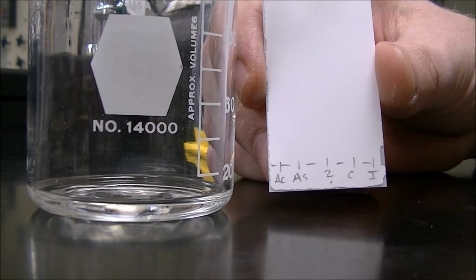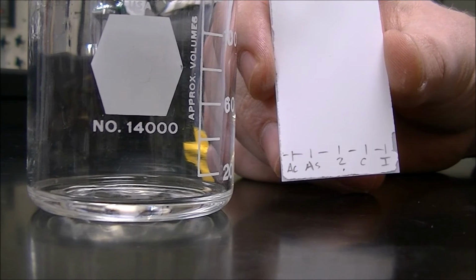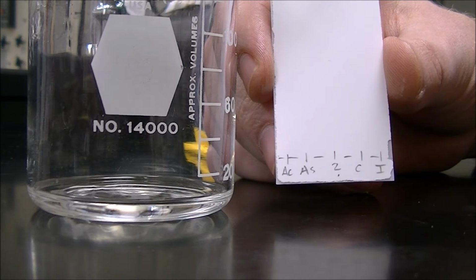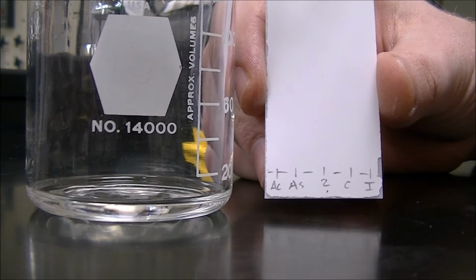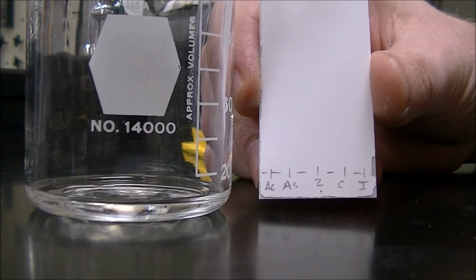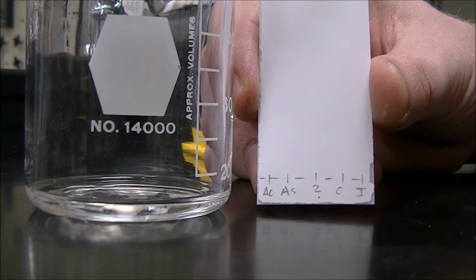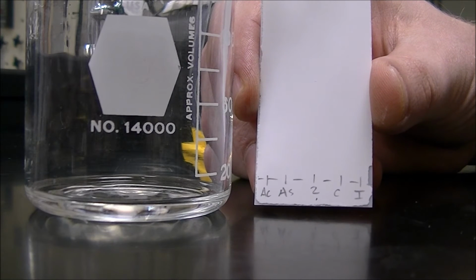Now we want the solvent to start on the TLC plate below where our spotted compounds will be, which will be on this line. And so you need to hold up your TLC plate next to whichever beaker you're using, with the solvent inside, to make sure that the line of the solvent is below the line on your TLC plate. And you can see that ours is just a little bit below, so we're good.